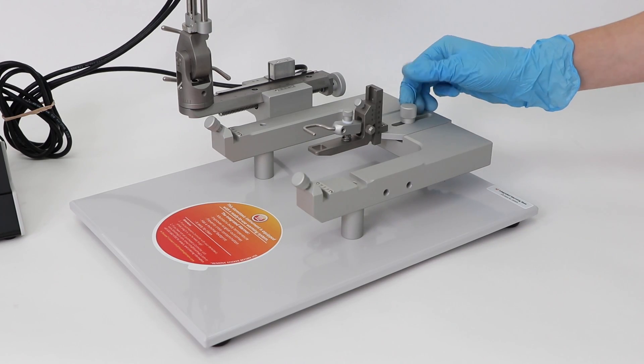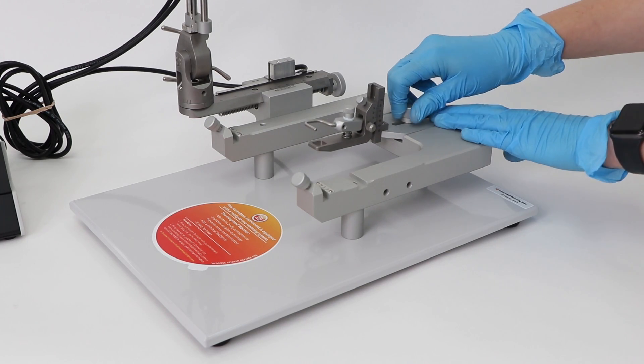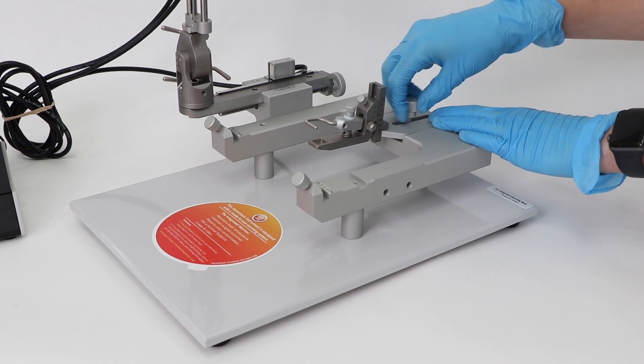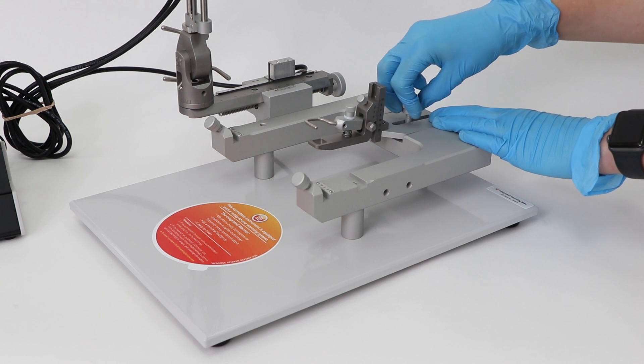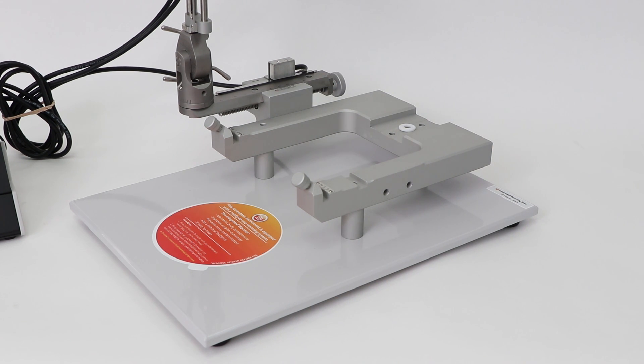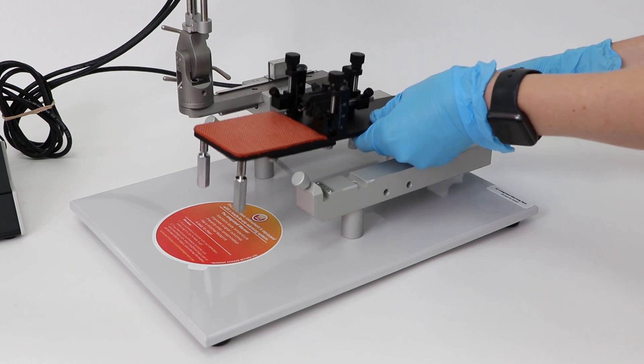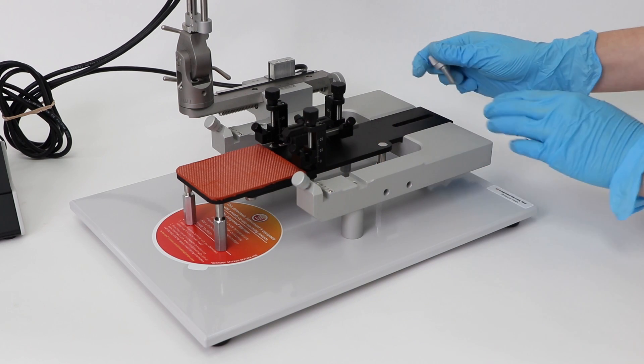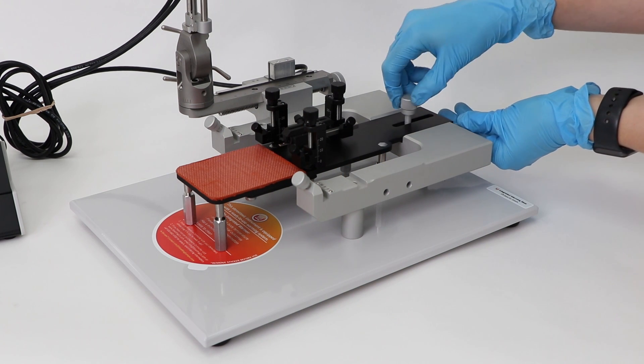Alternatively, for use with a mouse, you must attach the warming base to the U-frame. To do so, loosen the screw located in the center of the U-frame. Place the warming base accordingly with the base centered. Fasten the screw on the U-frame to secure the mouse warming plate.